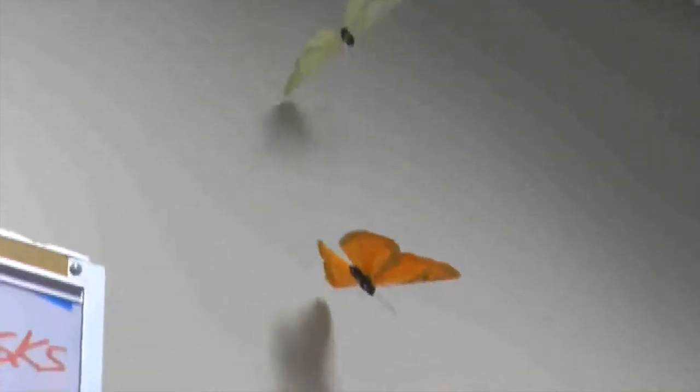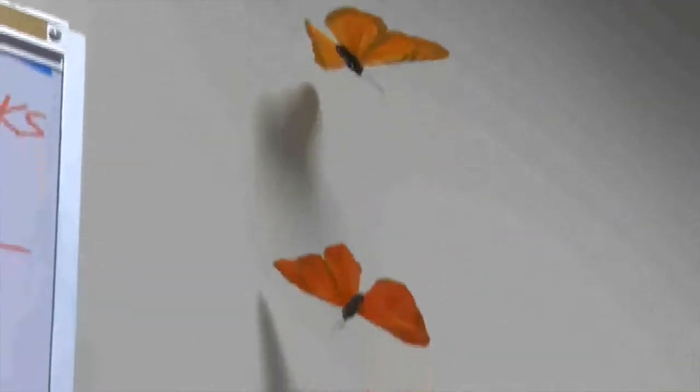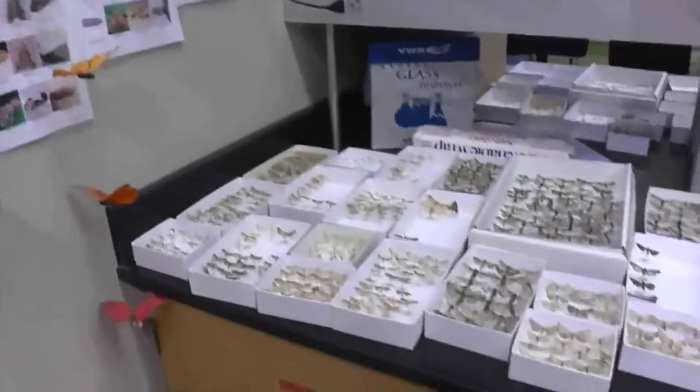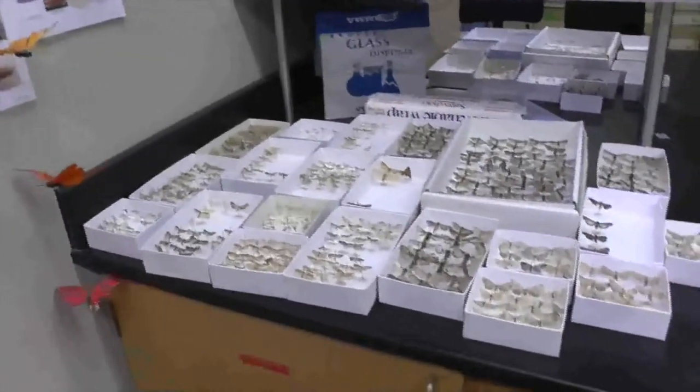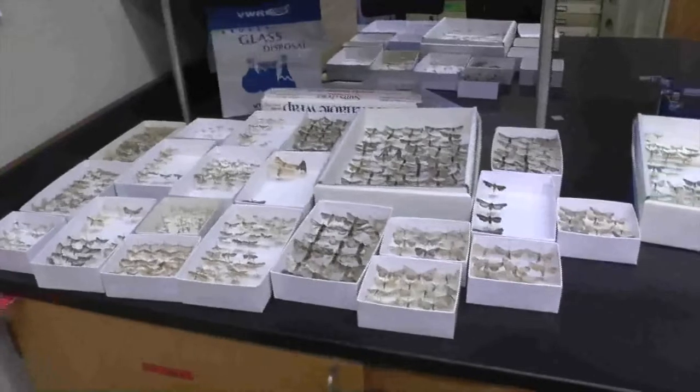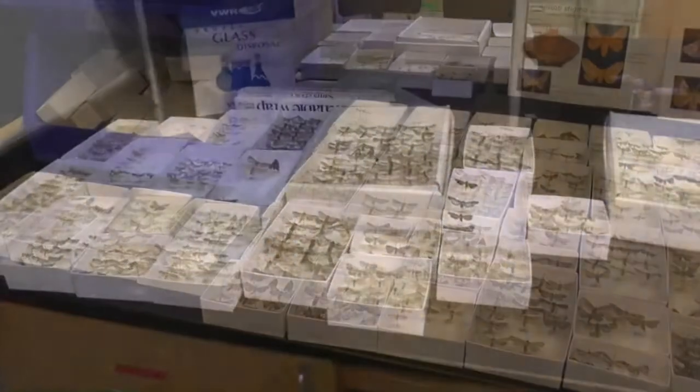Hey everyone, my name is Benjamin and I'm one of the students working with Dr. Van Zandt on his moth phenology research. In this video I'm going to give you a rundown on the methodology of our phenology experiment and the process we go through before we can turn an unidentifiable moth into a useful data point sitting in our lab.